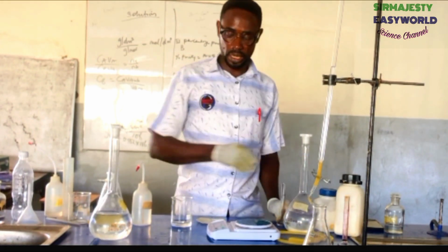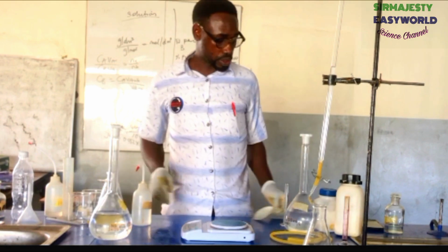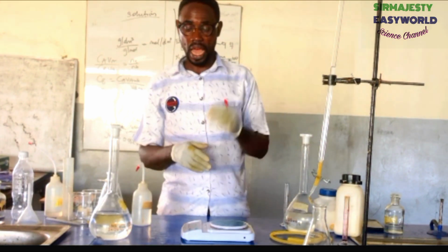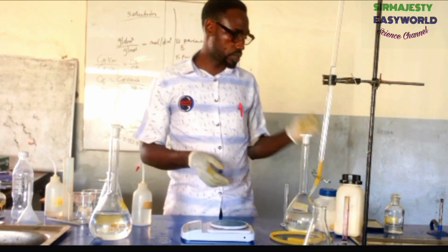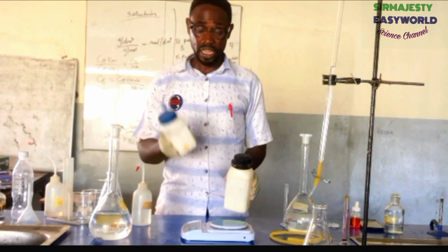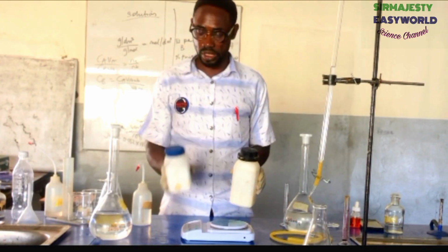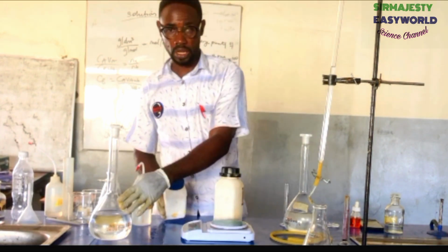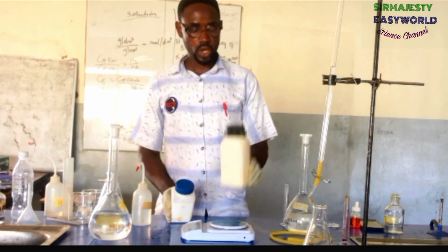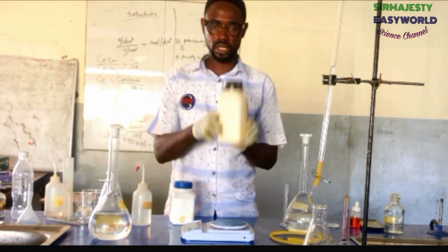Keep it aside. Then for B is a sample that is expected to contain 5.5 grams sodium carbonate anhydrous, of course, and then 2.5 grams of sodium nitrate. Over here is the carbonate, is the nitrate. The nitrate is going to act as an impurity. It's not going to react with the HCl at all. I'm talking about how to make B. They just added impurity. The sodium nitrate is an impurity, while the major thing that will react with this acid is the carbonate, sodium carbonate.